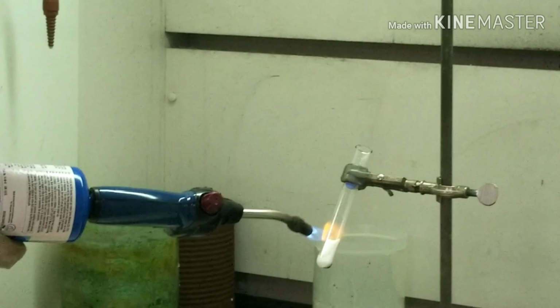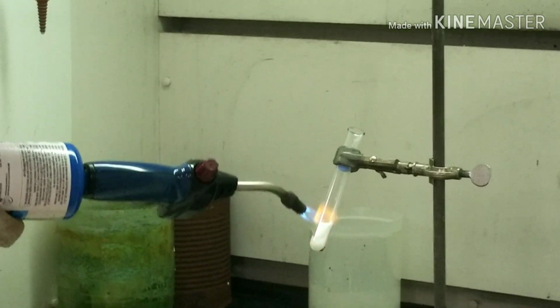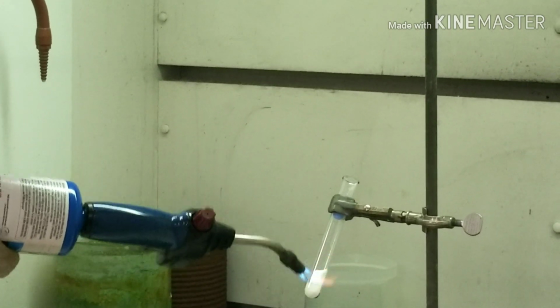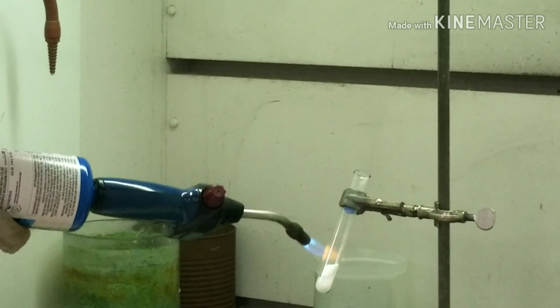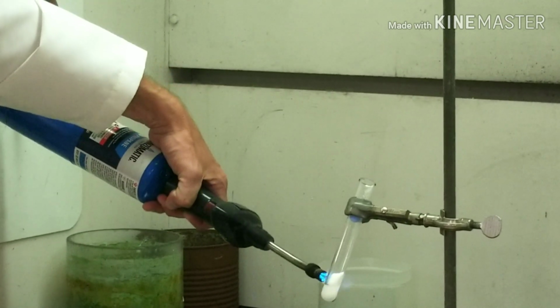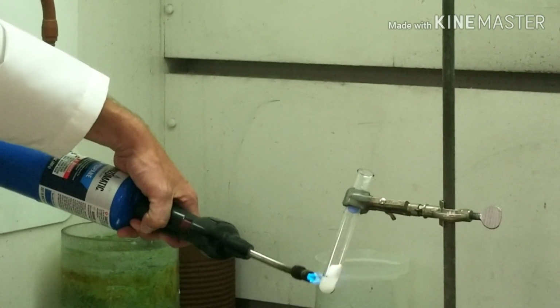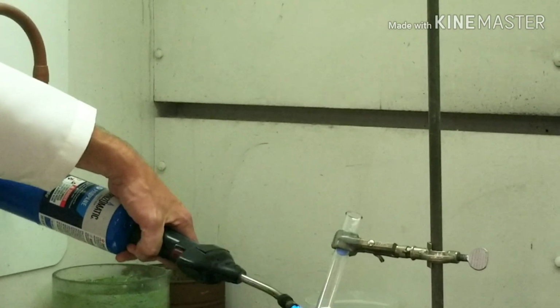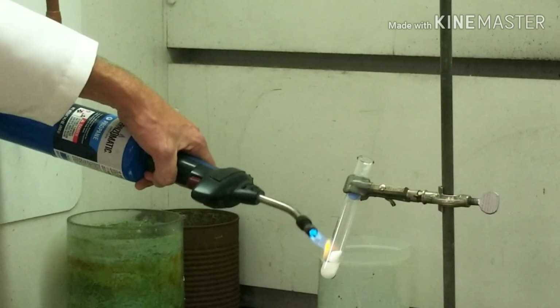So we will keep on heating this up. I want you to look to see what color the flame is when we see this. It may make you remember a different time we saw this color of flame. Think about what elements are getting very hot. Get back behind here, this side, heat it up. We're getting close. You can still see some solid potassium chlorate. We don't want to heat it too quickly. We're getting pretty close.